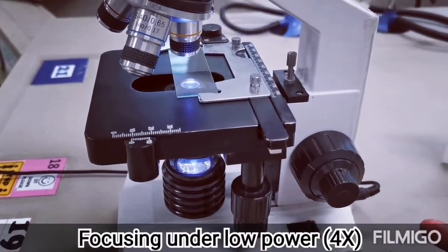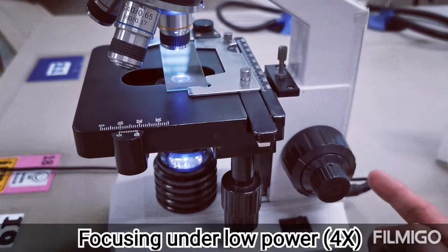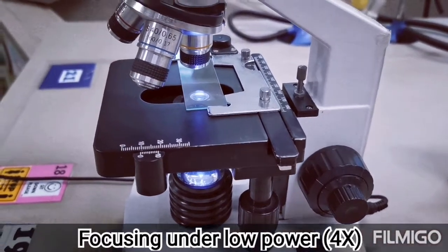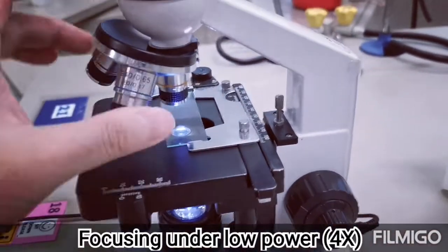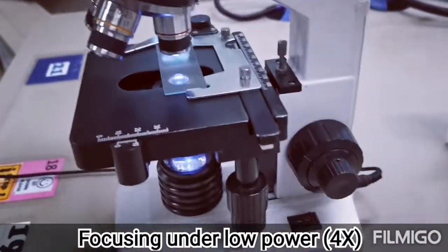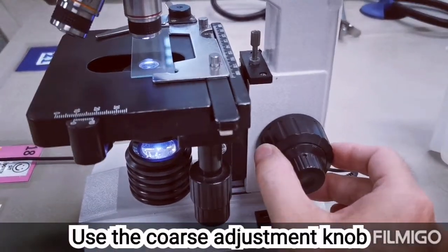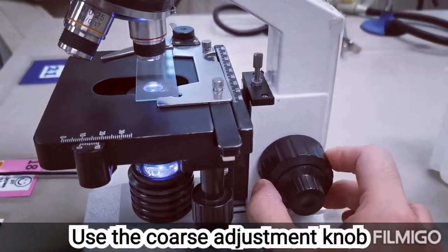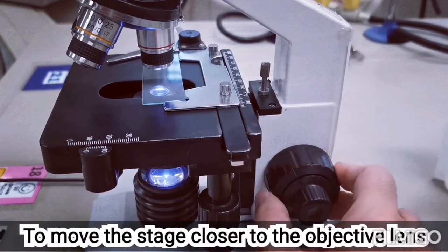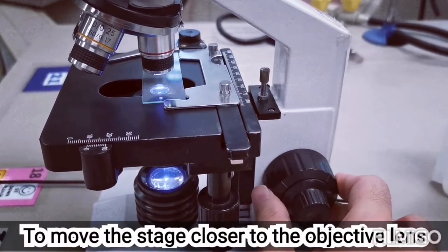So when you are focusing, to obtain a focused image under the low power objective lens, which is also the 4 times objective lens, we will use the coarse adjustment knob, which is the larger knob over here, in order to move the stage closer to the objective lens.